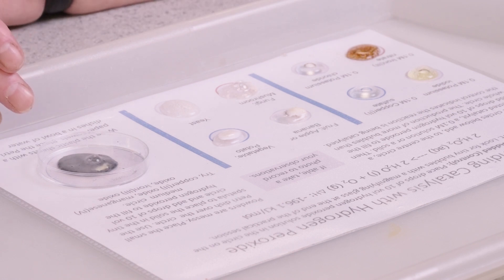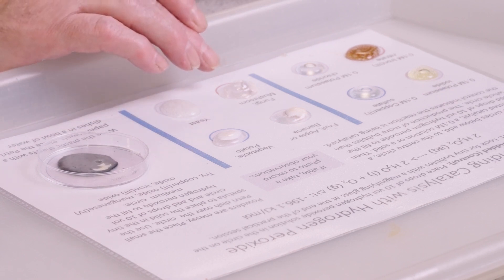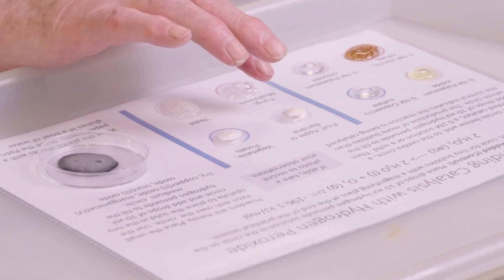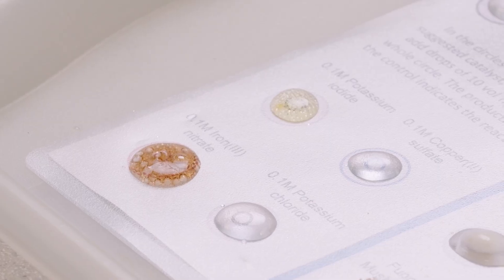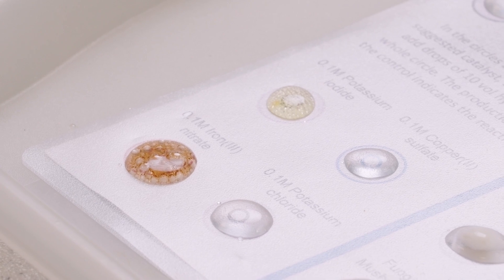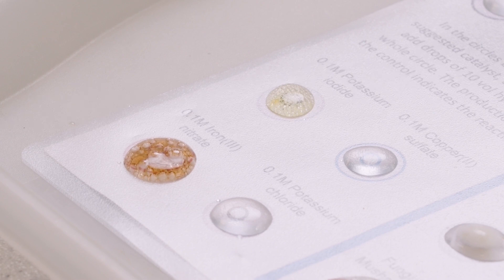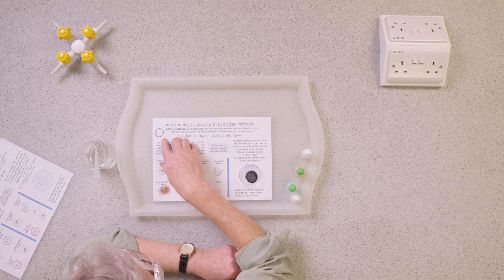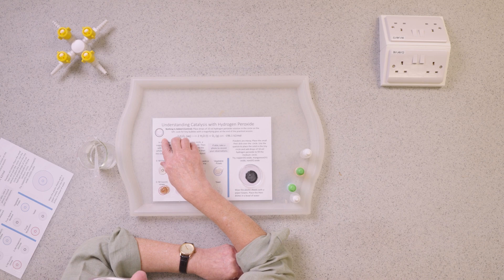Manganese dioxide produces lots of bubbles. The enzymes in yeast, mushroom, potato, and banana all show catalytic activity. We can see that iron 3 nitrate works, and potassium iodide is beginning to work. Copper sulfate shows just a few bubbles. There is nothing in potassium chloride. And finally, this is the control — if I look closely I can just see some bubbles forming, caused by the light in this room.